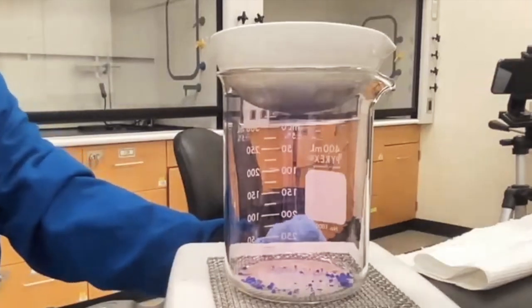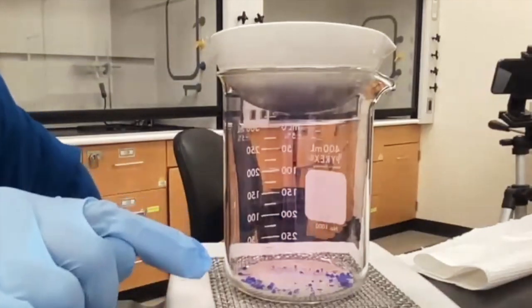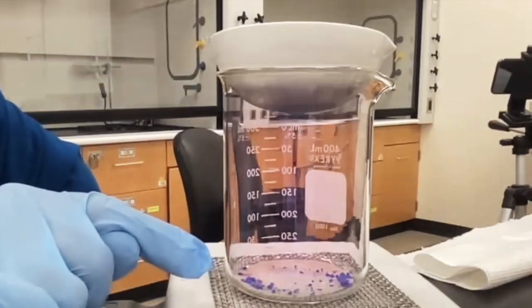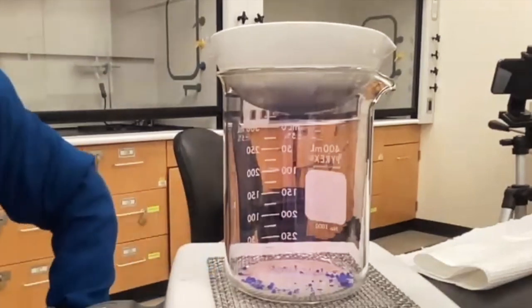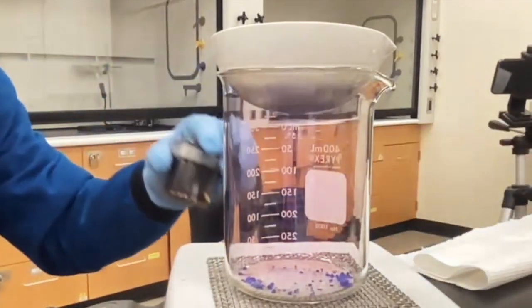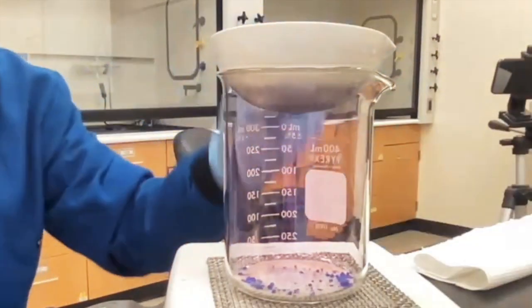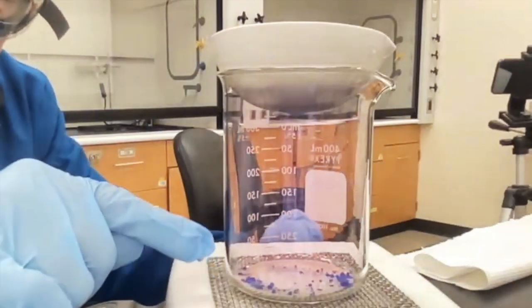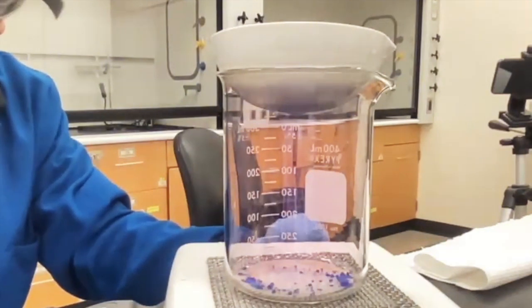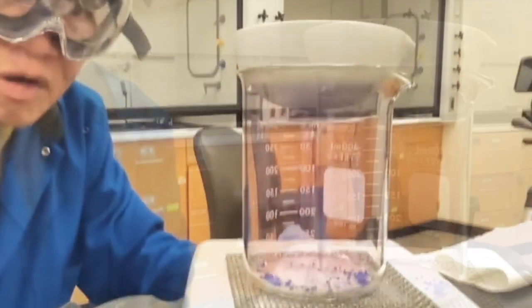So it looks like we're about there. But the other thing you want to do is you want to heat it up to the point where now you start to see color changes in the remaining chemicals that are left behind. Okay, remember what the cobalt chloride looks like? It looked like a violet color. The iodine looked like a gray color. Sand's just sand. But look what's happening to the remaining chemical, and I can't tell you what the remaining chemical is because that's your assignment. But look what happens to the color. Okay, look what's happening to the color of that chemical.